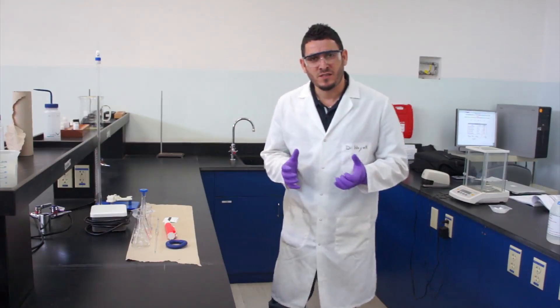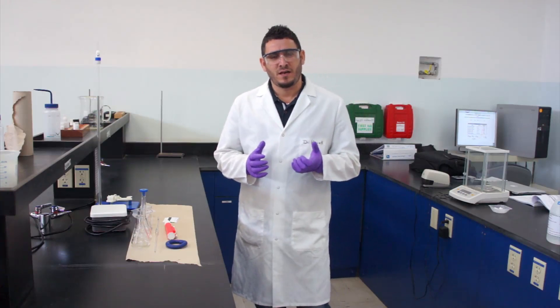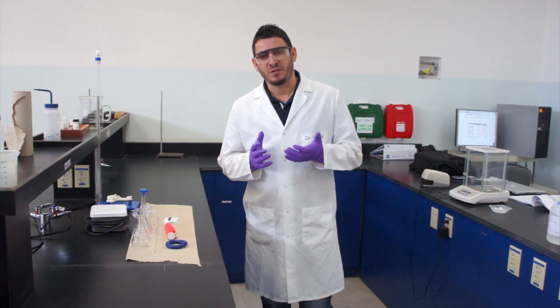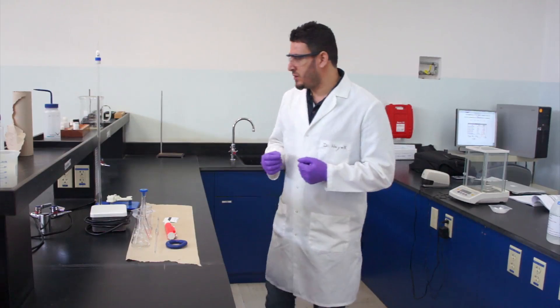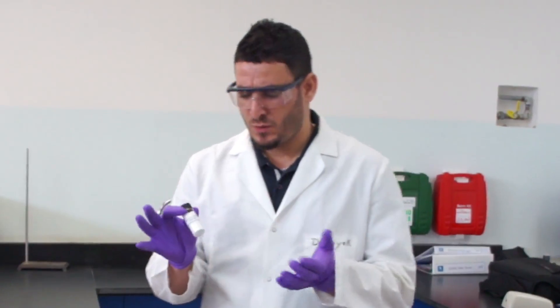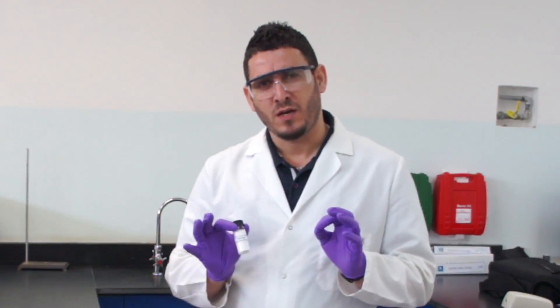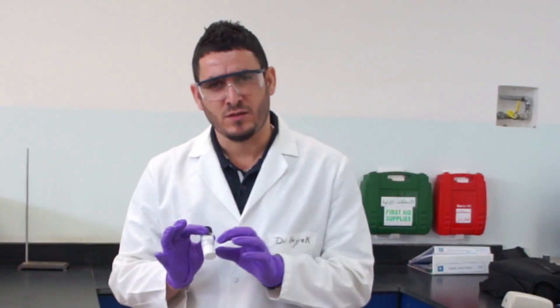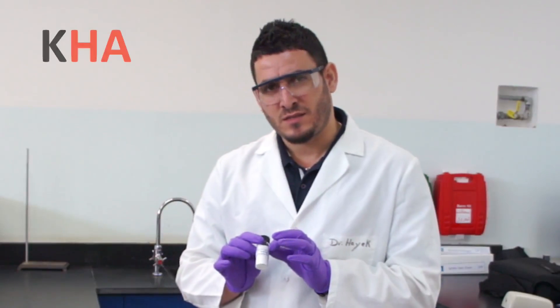Hi, today's experiment is about determining the formula mass of an acid salt. I will be given a solid where it's only written 'acid salt.' The only information I know about this acid salt is that it's made out of potassium.